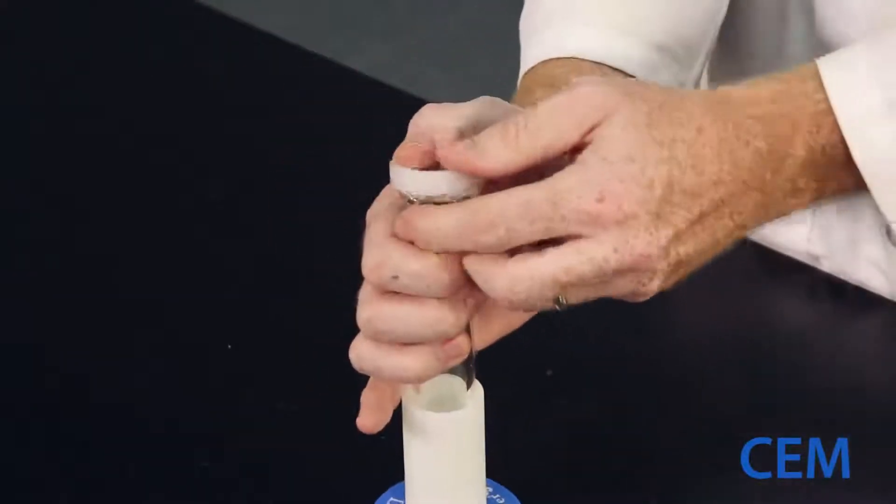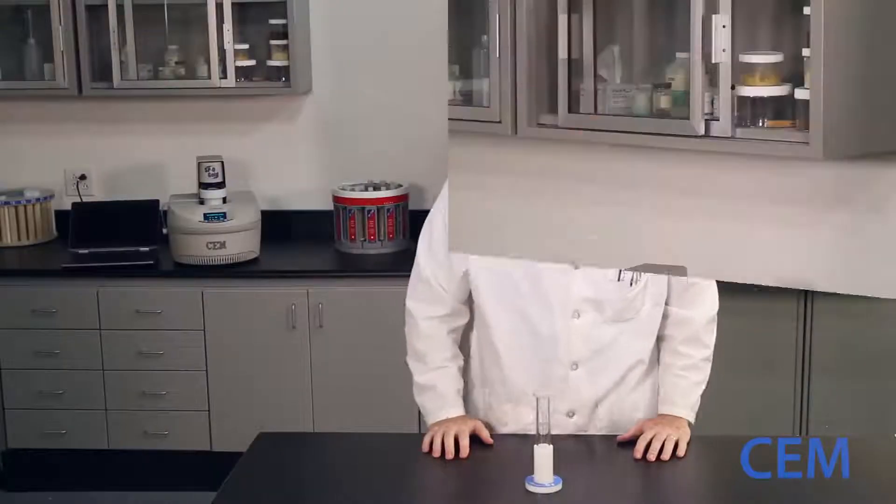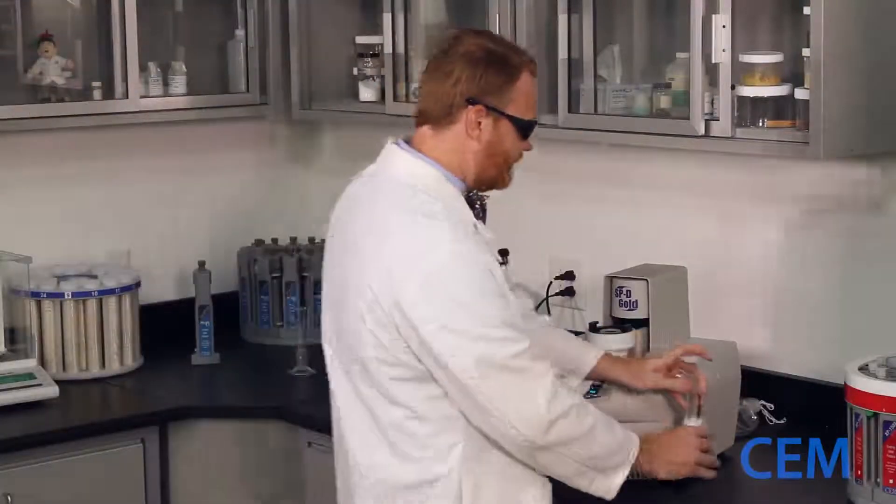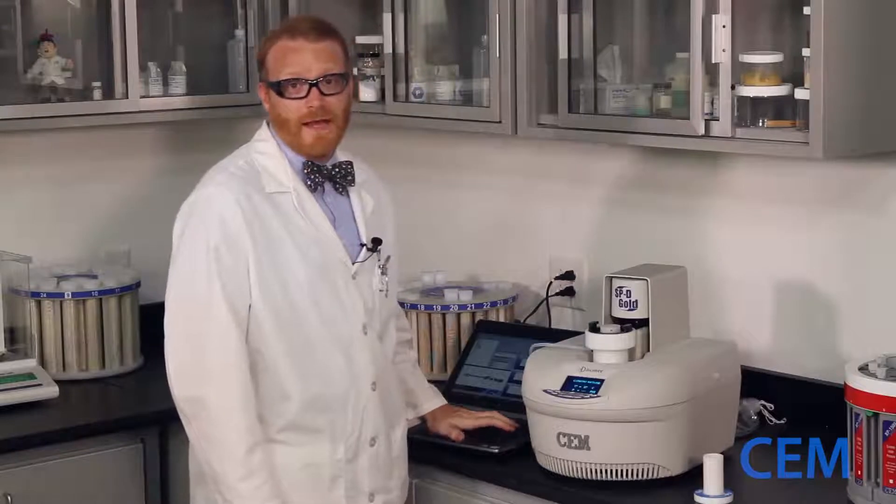We're going to cap this and take it over to our microwave. Let's give this a shot. Pun intended. So we'll take this, put it in our microwave, and start it up. Or as I like to say, blast it.